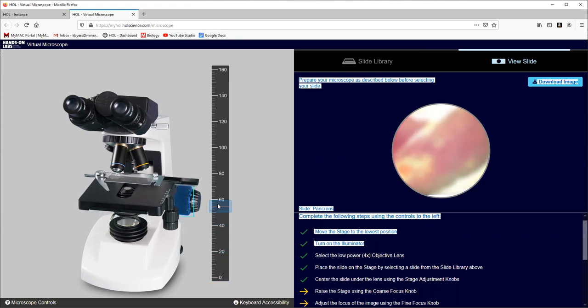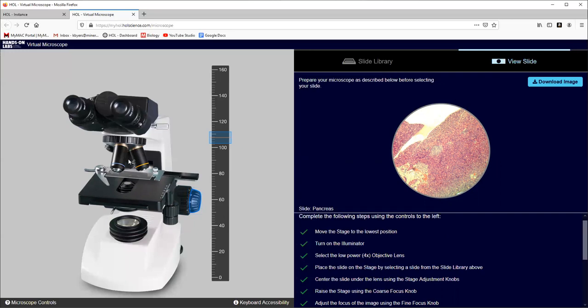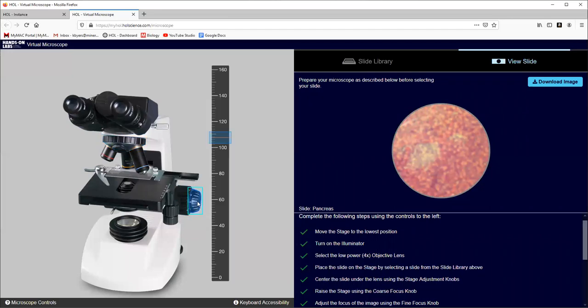I like to use my mouse and raise it until we're in close, and then I use the arrow keys on my keyboard to get pretty close. Once you can actually see your object, see the cross section or whatever we're looking at, then you can move to the fine adjustment and just move that until we're perfect. See that nice image? Now we're still on scanning. Now these microscopes are parfocal. That means we can move to different lenses without actually moving the stage, and what we are looking at, our specimen or our slide, should still stay relatively in focus. We may have to adjust the coarse adjustment or move the stage around a little bit to find what we're looking for. But moving from 4 times to 10 times should just zoom in. If it's a little blurry, we click on that fine adjustment and use the arrow keys and get just perfect.